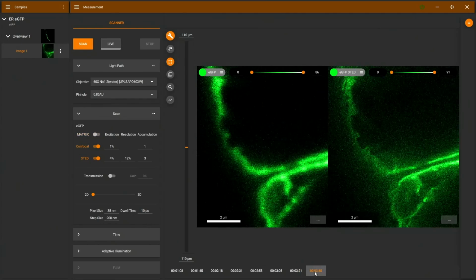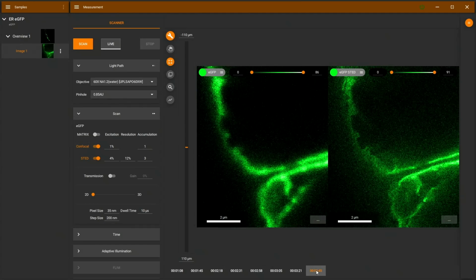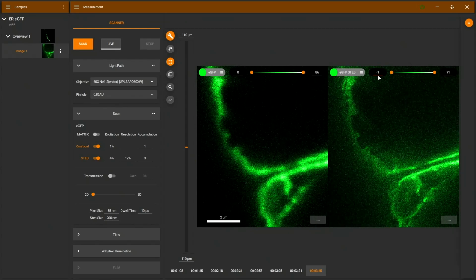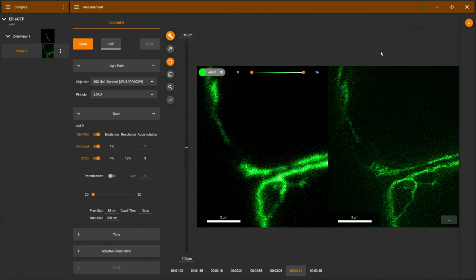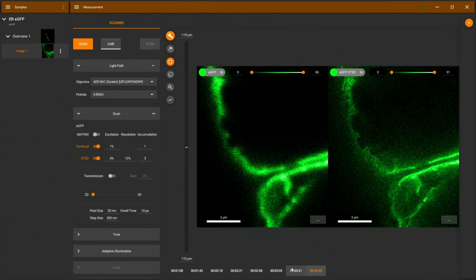So I think, just as promised, we can combine matrix detection and STED, and it removes a lot of the haze. And that's really the case because in STED microscopy, we are removing a lot of the in-focus light because we're switching off fluorophores, and we leave only the ones in the very center of the scanning spot to get the super resolution effect. So effectively, we have fewer fluorophores. However, what we're not doing with STED is switching off the out-of-focus light. And this is why matrix can be so helpful here to reduce the out-of-focus light and to still highlight the very highly resolved proper signal.